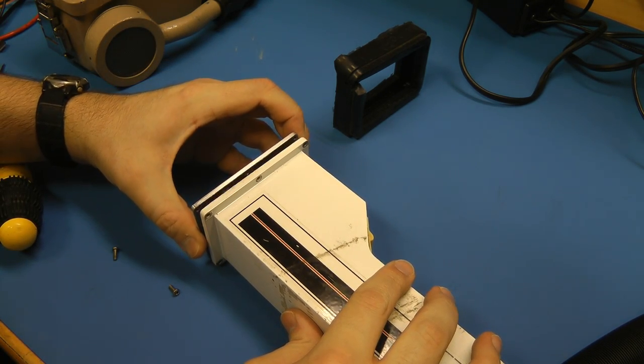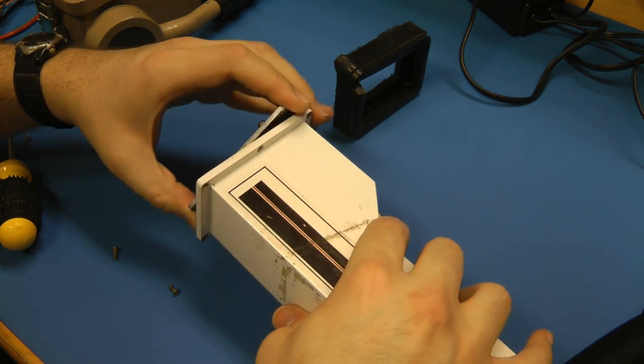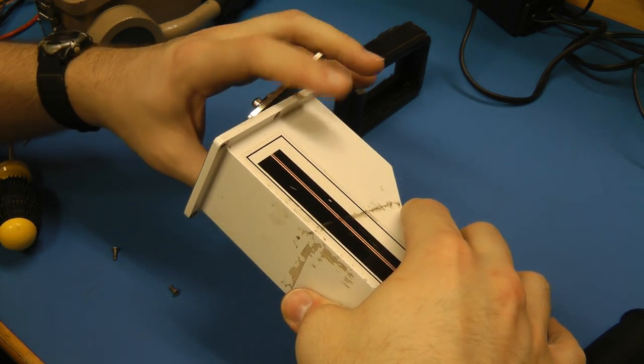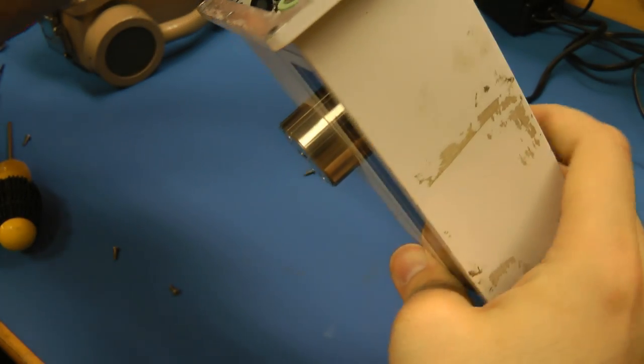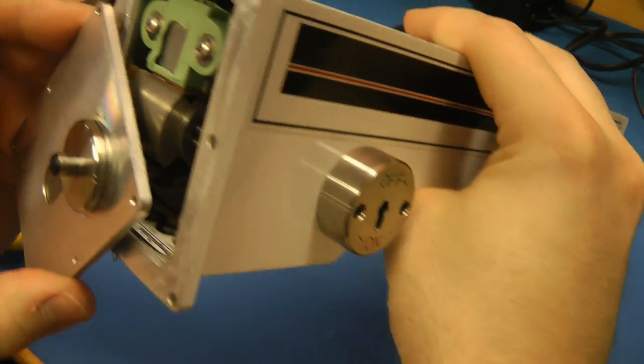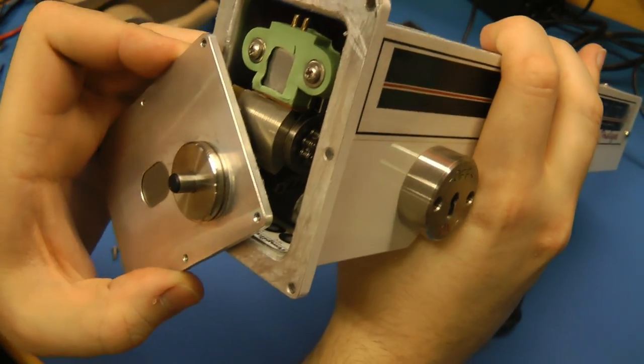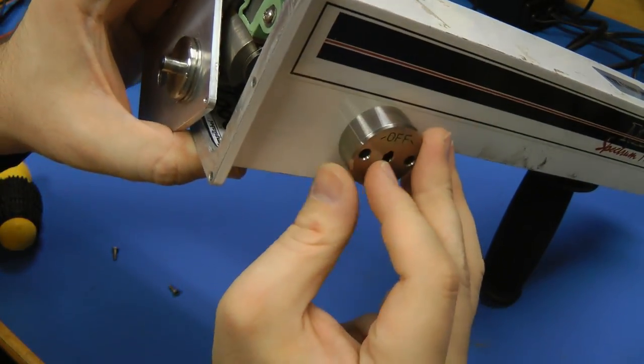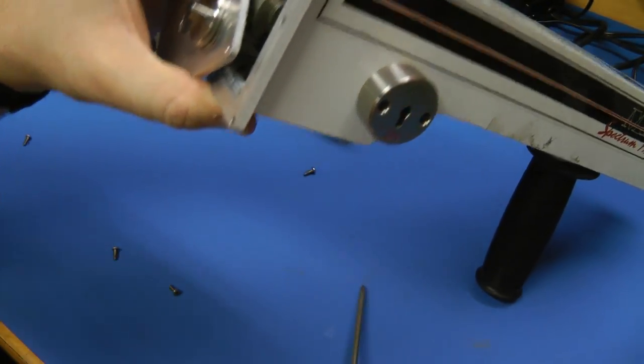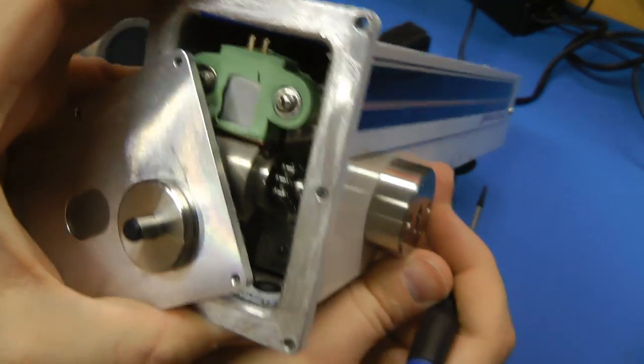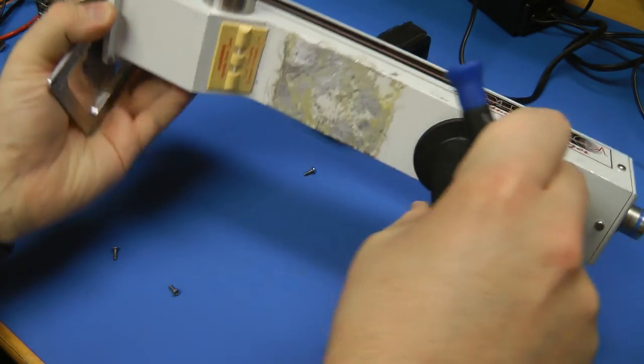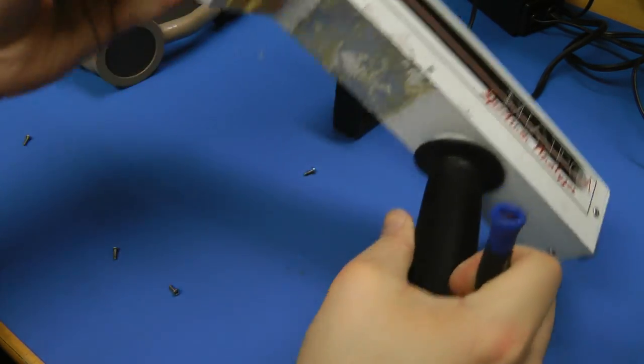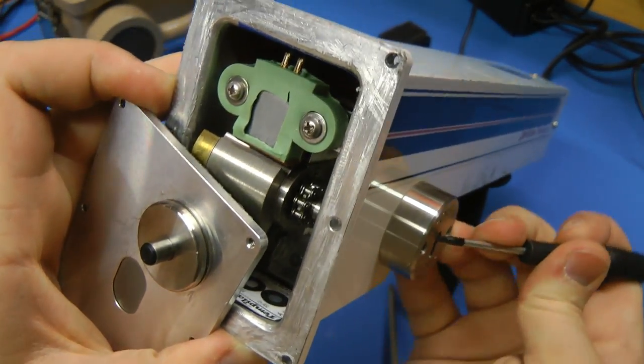Okay, let's see what's in this thing. So what do we see in here? It's a bit hard to see. Let me put the camera around a bit. But we definitely have some sort of a chain thing. Let's see, there we go. So yeah, so far the detector is detecting nothing. So that's good.